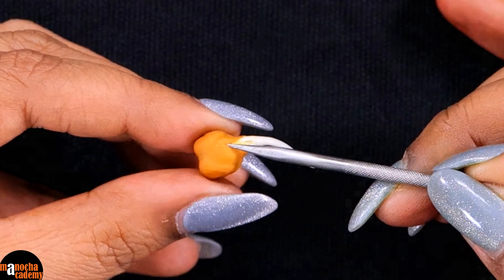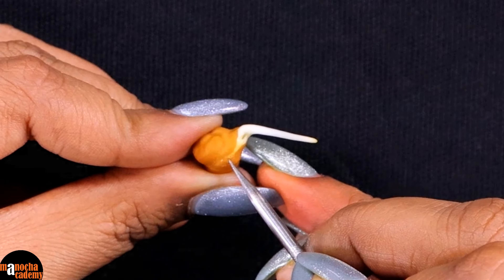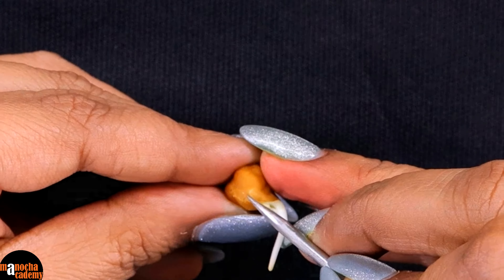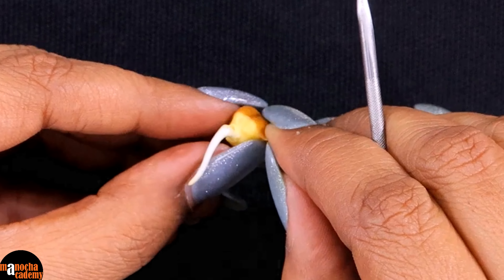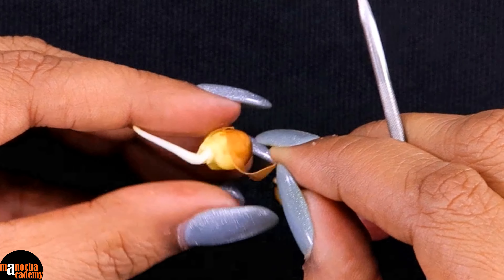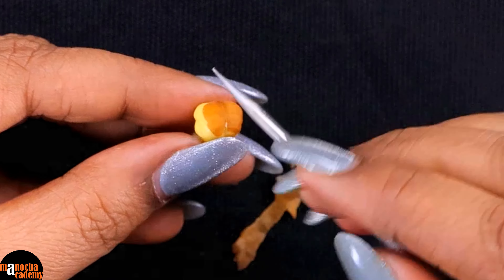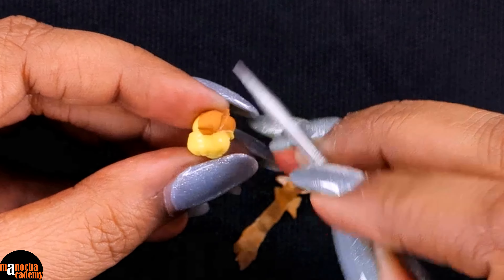Now let us take out the seed coat first. I am giving an incision here and I am just going to tease the seed coat so that it peels off or simply comes out. The structure that you see is the testa, which is the tough outer covering. The tegmen is very thin and almost attached to the cotyledon, so I am not going to try to take that out because that might damage the seed.